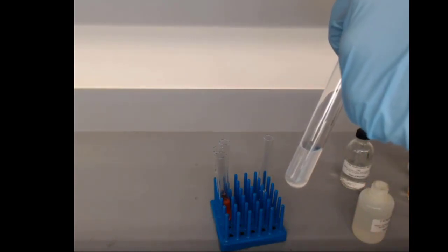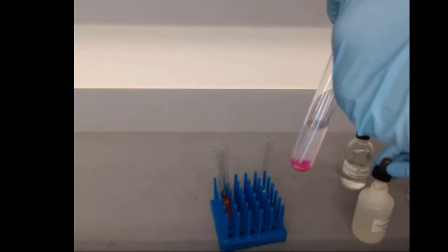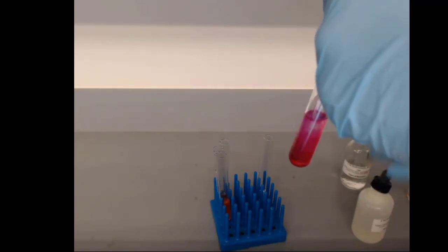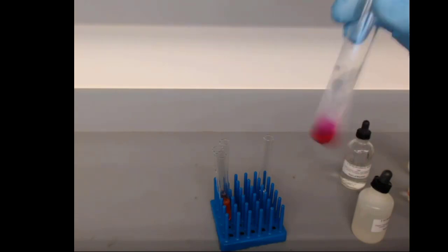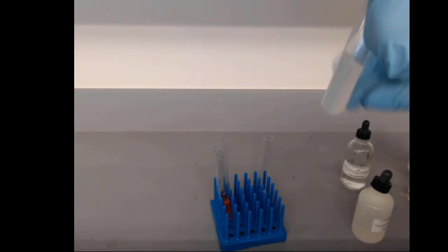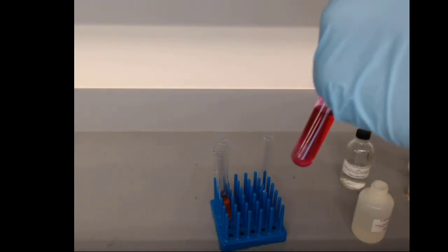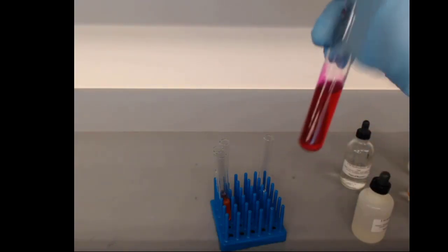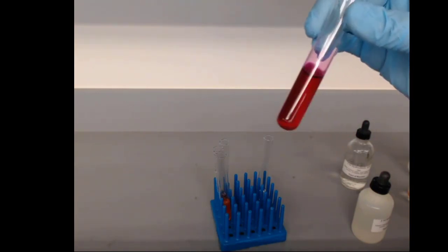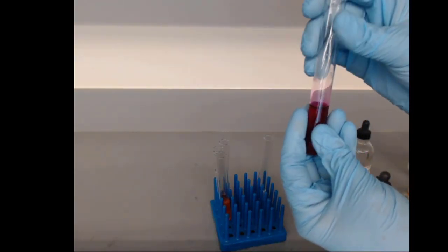And then as I add sodium hydroxide, it goes pink. So that shows, oh, and that didn't take very much sodium hydroxide. Let's see there. Shake it around, get the reaction going. Okay. So we can see that a chemical reaction is happening. The phenolphthalein there just gives us some visible cue to the chemical reaction. That's the reaction of acetic acid with sodium hydroxide. Doesn't warm up nearly as much.